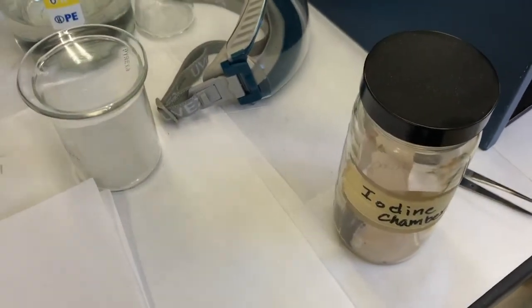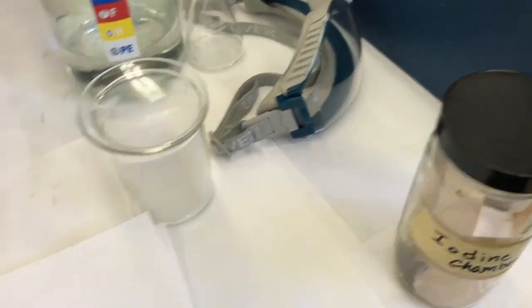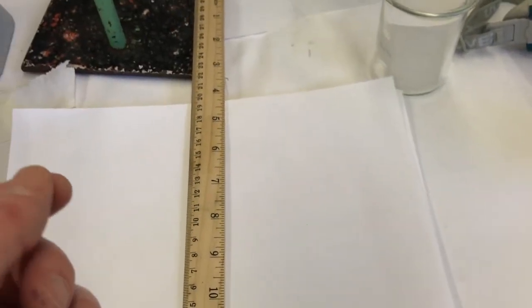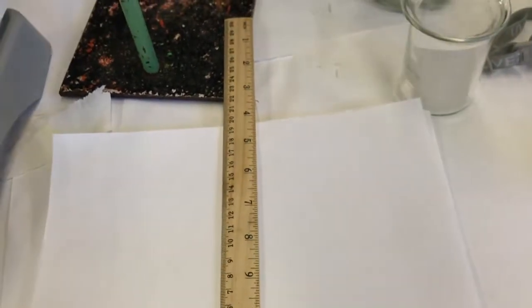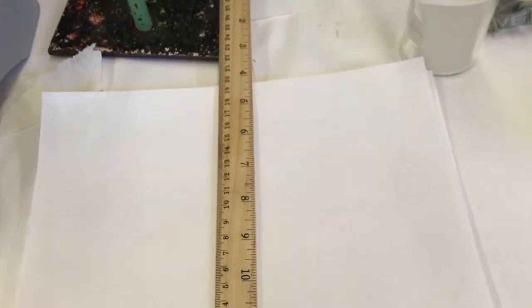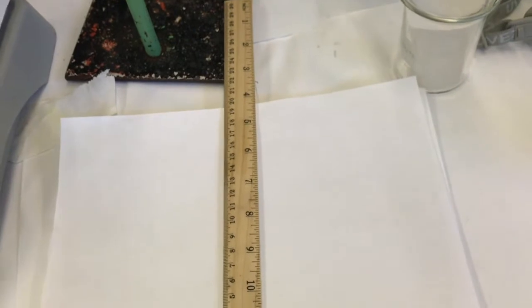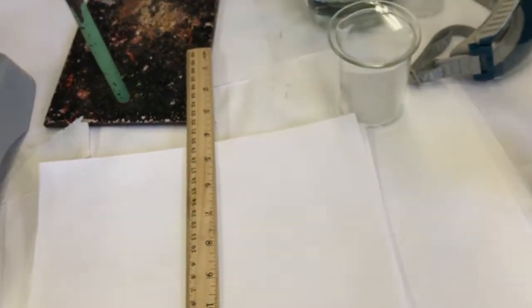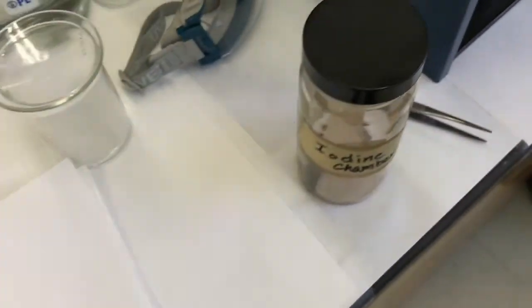So this, visualizing your TLC plate with ultraviolet and with iodine, that's 2 of many different techniques. There's other ones where you have a solution that's got an oxidizer in it and you put the TLC plate in there, and then when you take it out, molecules like alcohols that can be oxidized turn a certain color. You might turn green or something. And there's other ones where, if you have a ketone, it's maybe orange. And it's pretty cool. You have different developments you can use.